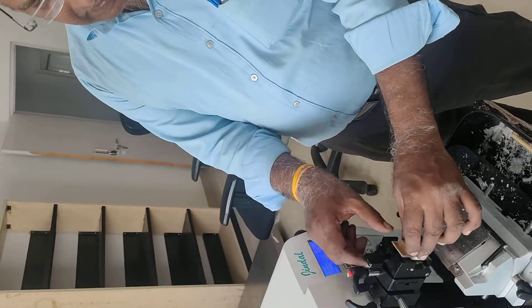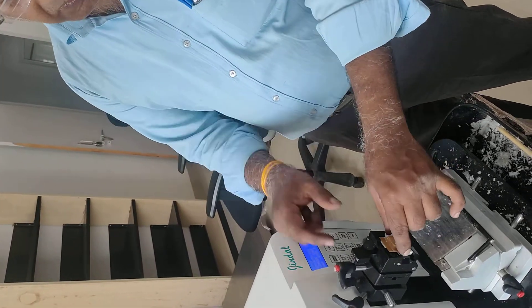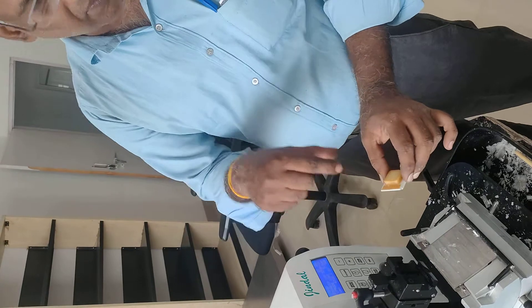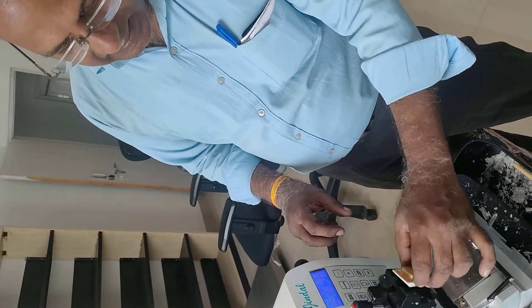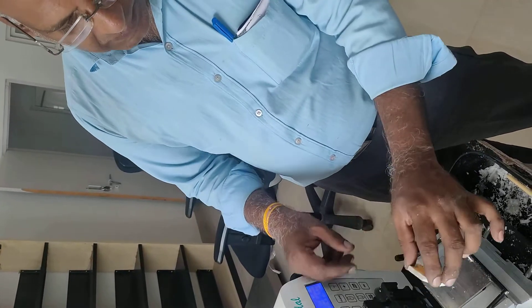What we have done here is press the lever like this, and it will be tight. The tissue will come to the side. As we mold it, we have to keep it to the side. Therefore, we have to keep it this way. Then, we will open this outside.